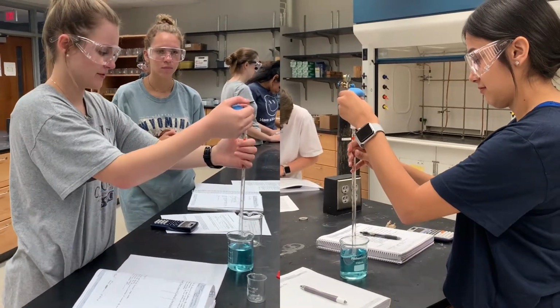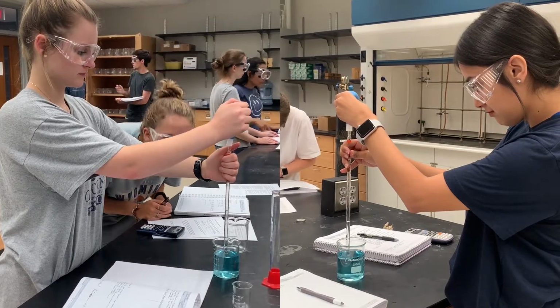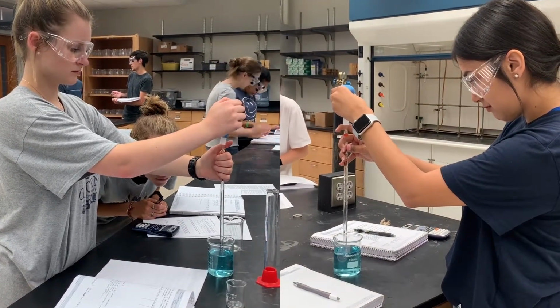After completing the process once, we repeated it 2 more times to complete the experiment, and we recorded all the required data.